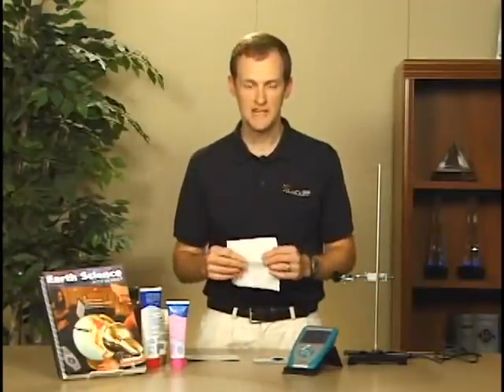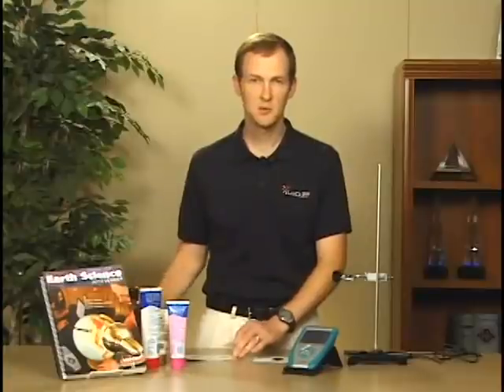You'll want to wipe your hands between each application of the sunscreen because you don't want to pollute your samples.